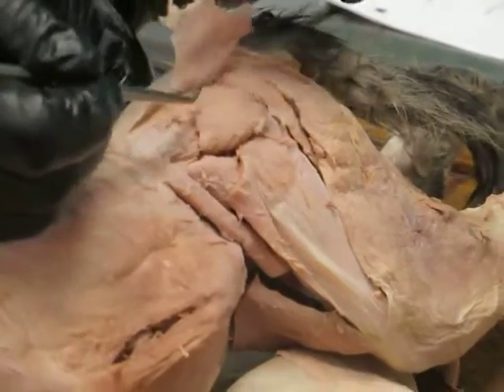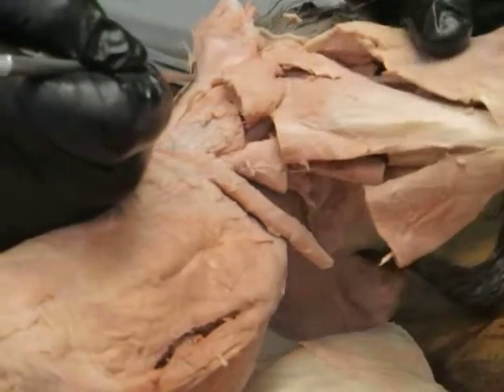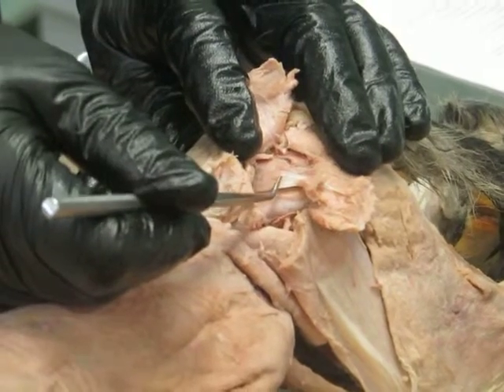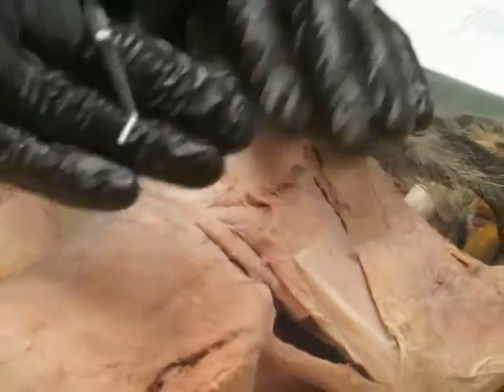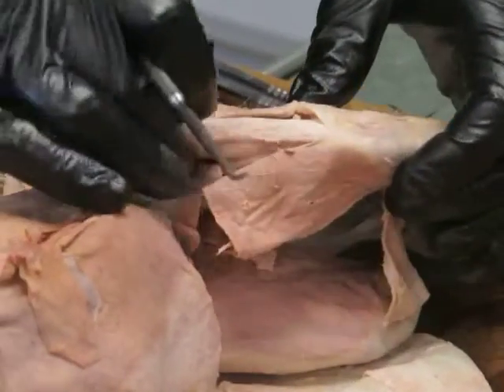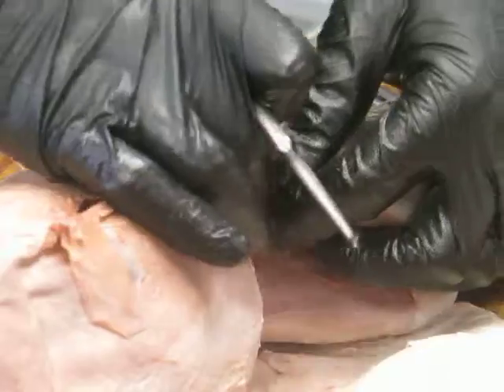If we flip that back, you can see deep to that, gluteus medius, also abductor of the hip. Gluteal muscles in general are abductors. And then if we cut through gluteus medius and look deep to it, there's another muscle down here, and that would be gluteus profundus. Okay. So put all those guys back. So those are all the gluteal muscles, the three things that are actually called gluteus plus tensor fascia latae.